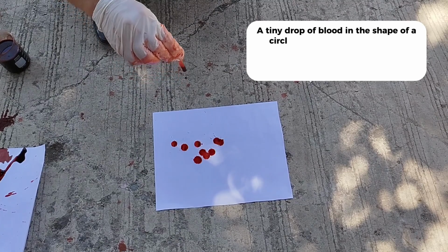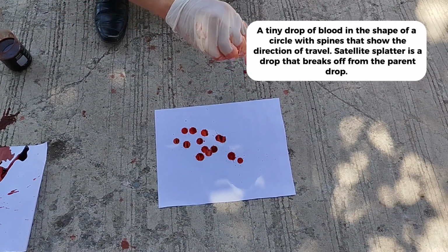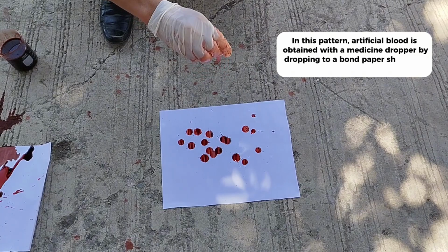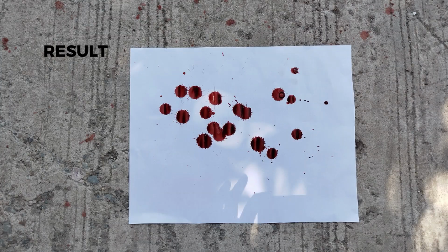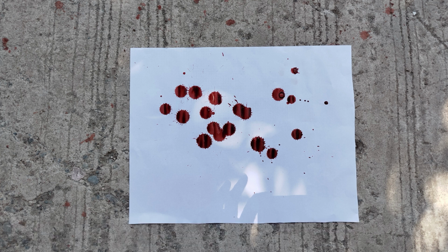A tiny drop of blood in the shape of a circle with spines that show the direction of travel. Satellite splatter is a drop that breaks off from the parent drop. In this pattern, artificial blood is obtained with a medicine dropper by dropping onto a bond paper sheet on a slightly rounded surface. We inject the blood by repeatedly dropping it in. As can be observed in the image, both the satellites and the droplets have visible spines.